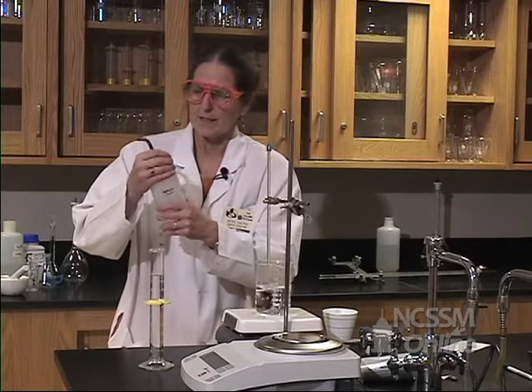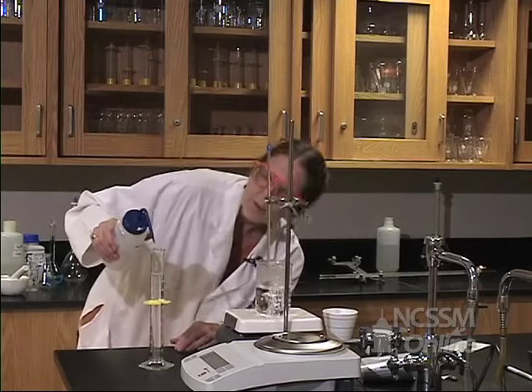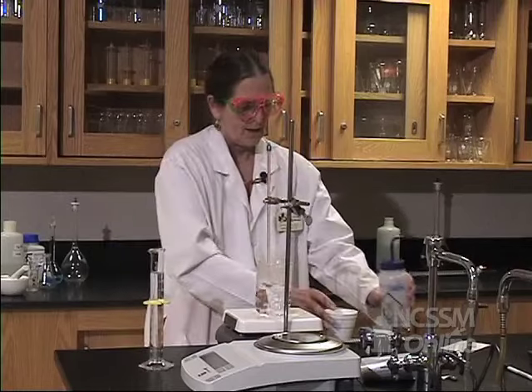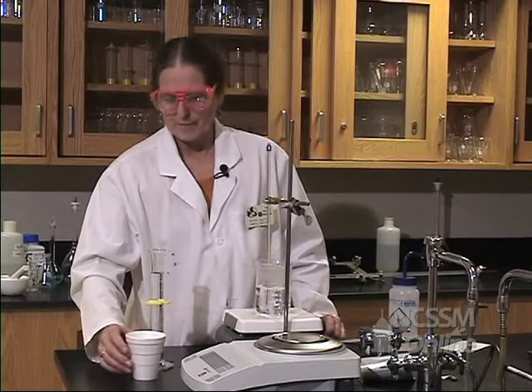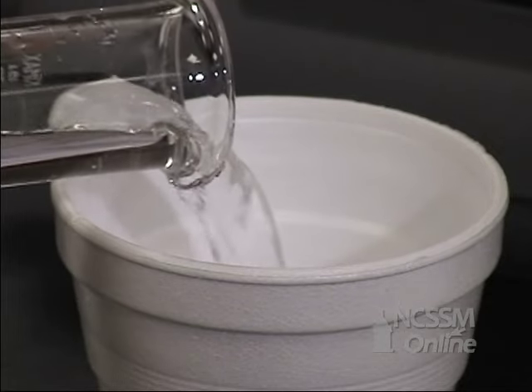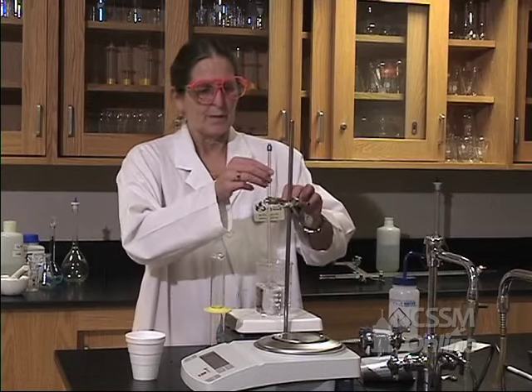This water is at room temperature. When we put this hot metal in there, the water is going to gain heat. We're going to use our coffee cup calorimeter because it's insulated, and we're going to assume that it gains no heat — that the water gains all of the energy given off by our metal.